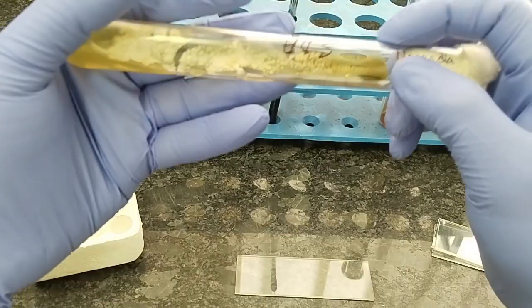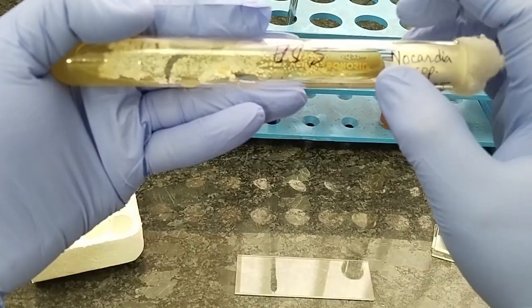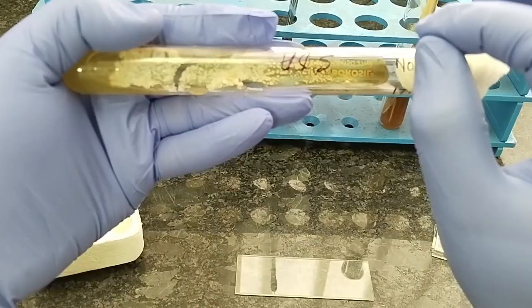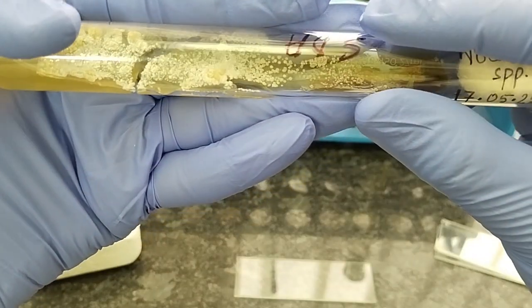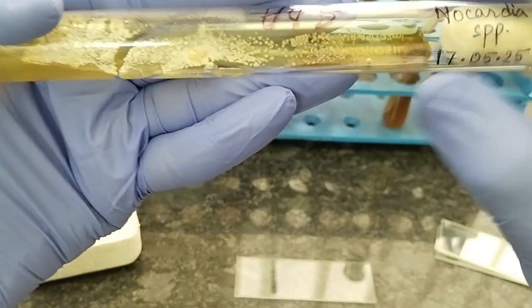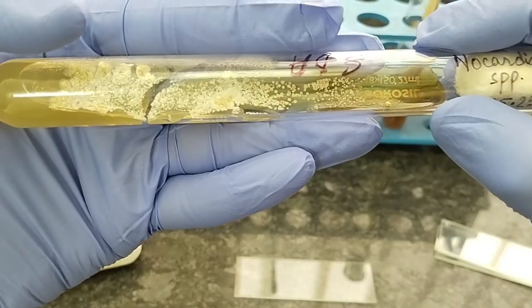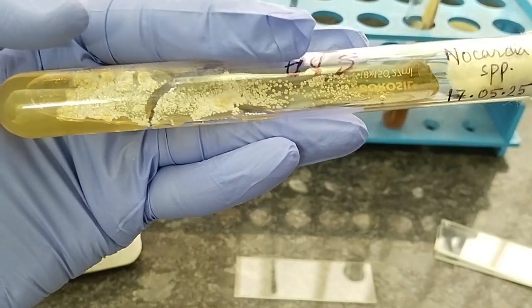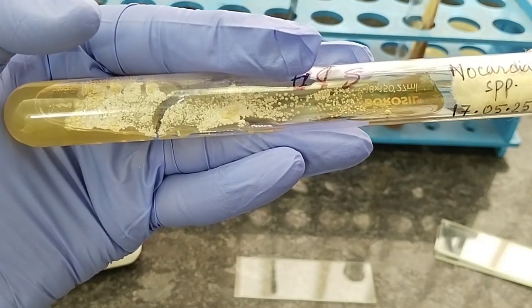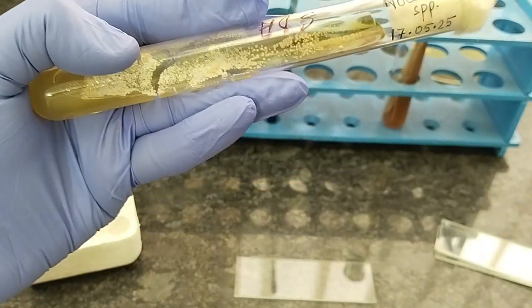So here, first of all, we have to look into the characteristics of the colony. Nocardia colony on the culture media is dry. You may see this colony is dry, powdery, and sometimes filamentous, but in this case the filamentous appearance does not appear here. They can be white or various shades of yellow, orange, pink, red due to the production of pigmentation. It may produce different types of pigment.